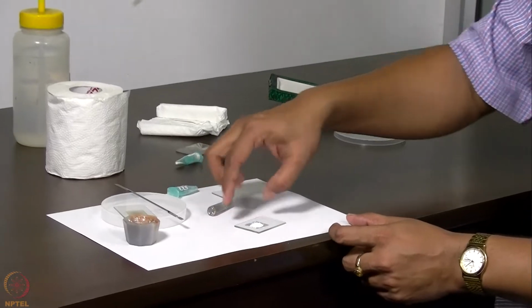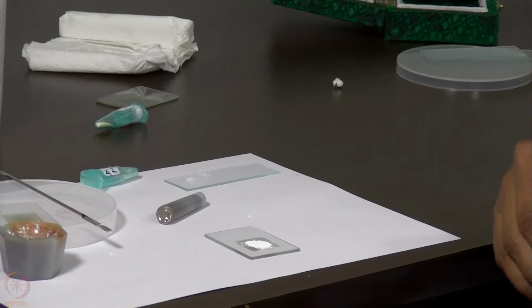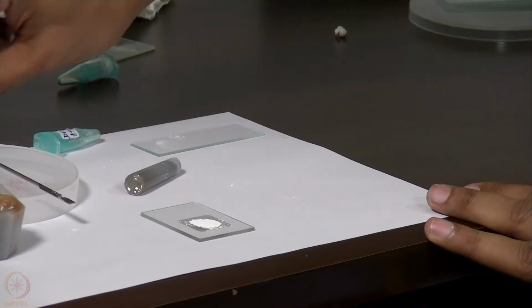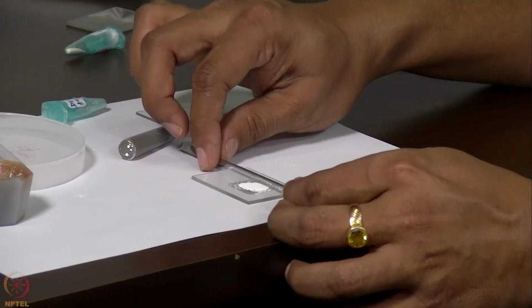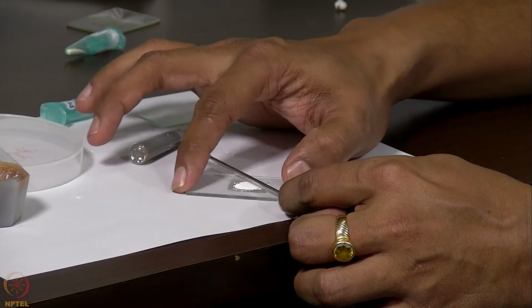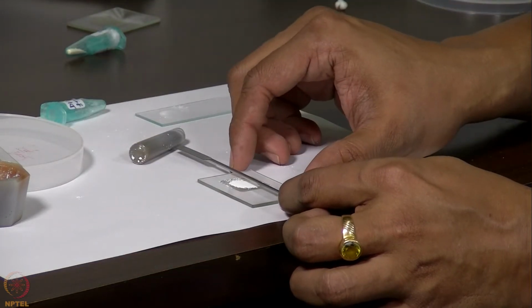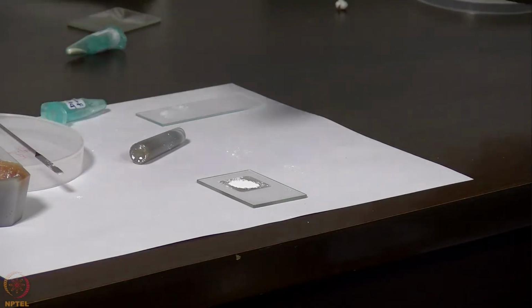like this at 120 rpm so that the entire sample is evenly exposed, because the beam that we have here is a line focus, which means the beam is like a line, and if we rotate this sample below the beam, the entire sample gets exposed to that beam. So this removes any preferred orientation effect that might be there in those microcrystalline particles.